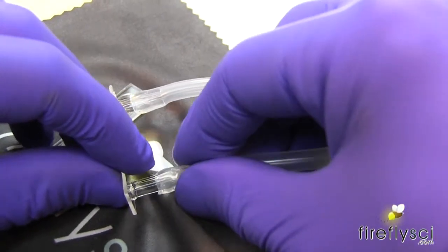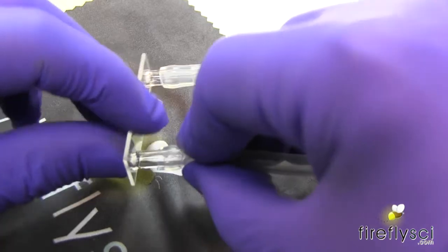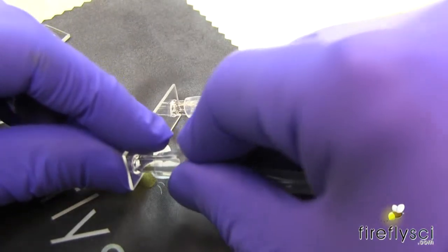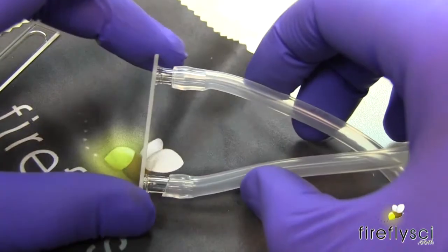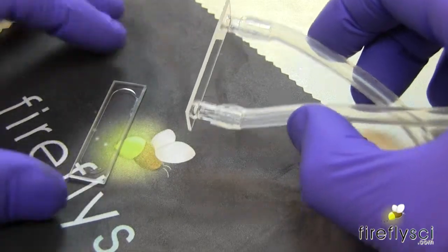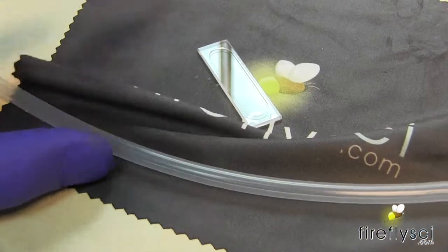Let's give it a push. Okay. So the tubing is connected and now we're going to go ahead and assemble this. So I'll take our plate here and put this to the side.